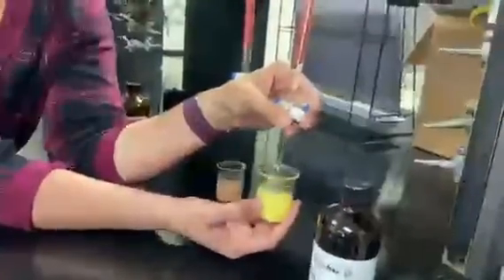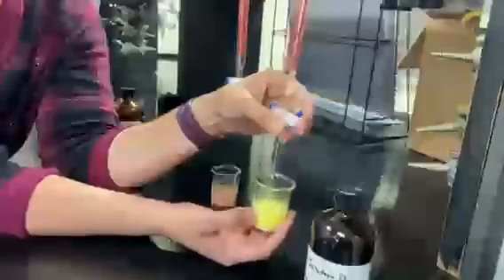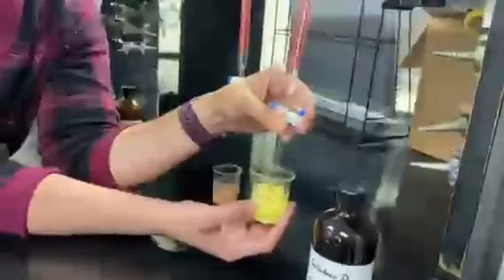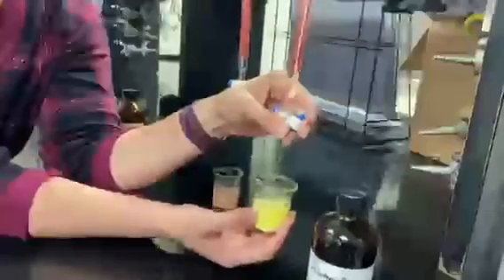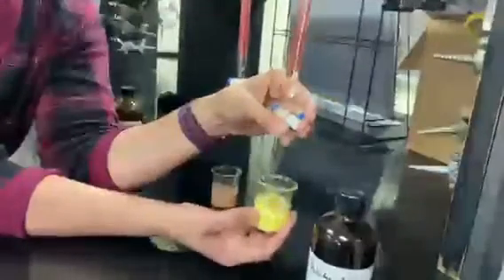Okay, this one is a long one, but like I said, we're only going to show you one trial of each. We'll send you the rest of the data. You don't need to see us do this 4 or 5 times. Normally we'd break you up into groups and have you go visit each station once and combine the data. It's a good lab for that.